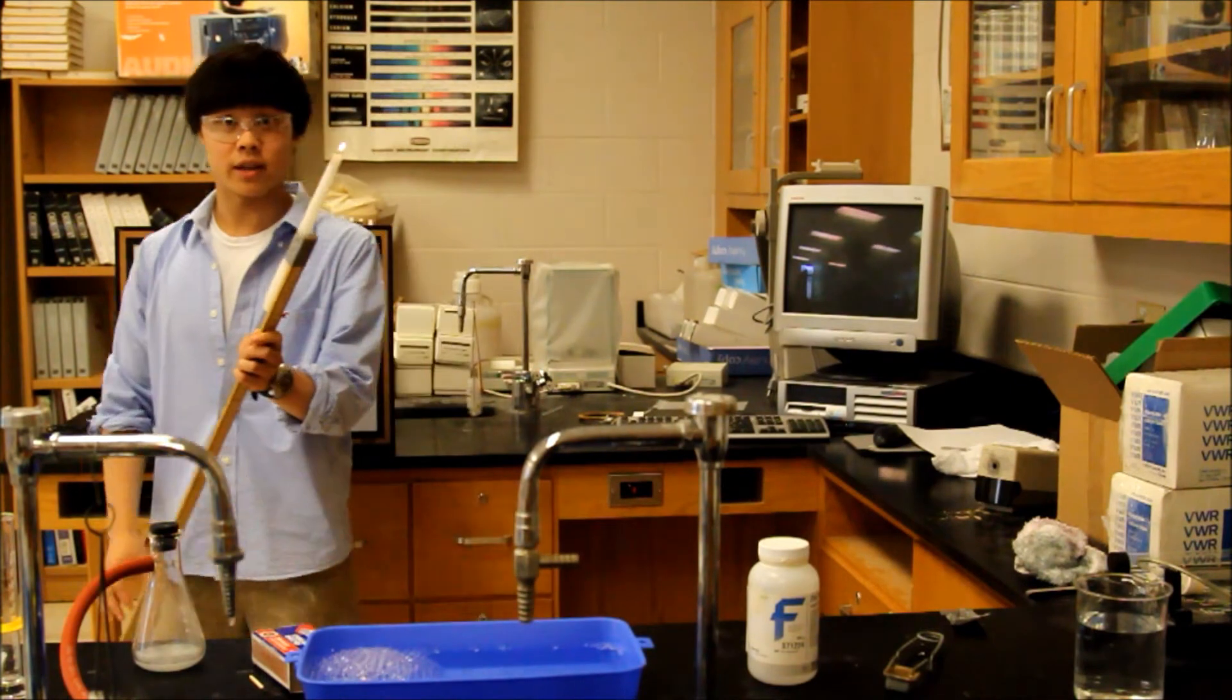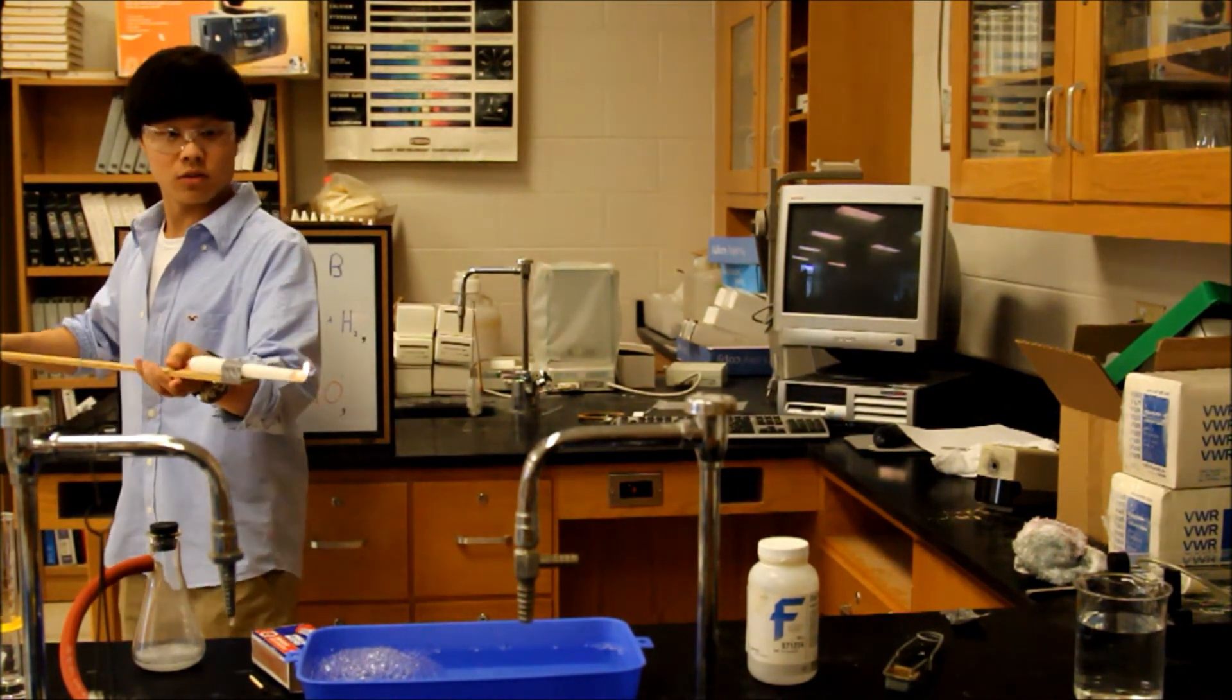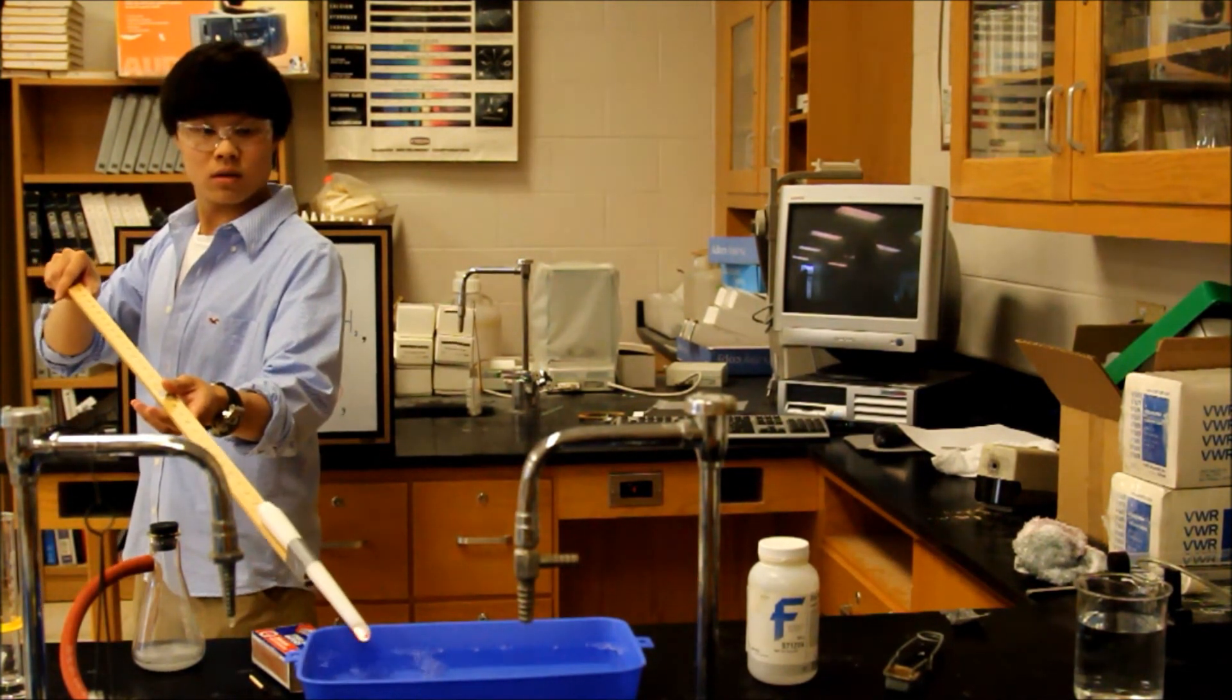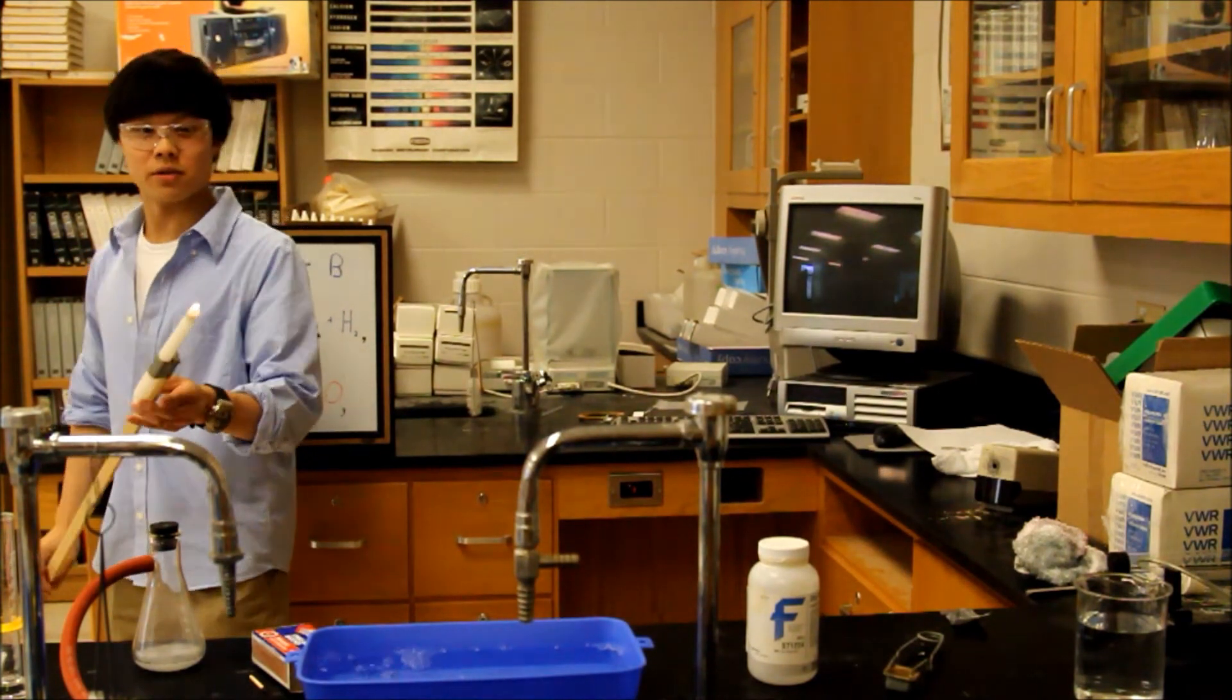So if you were to ignite the hydrogen with a candle, that would be the result.